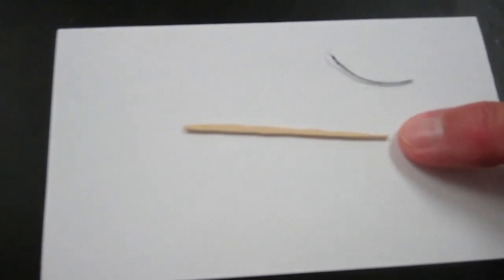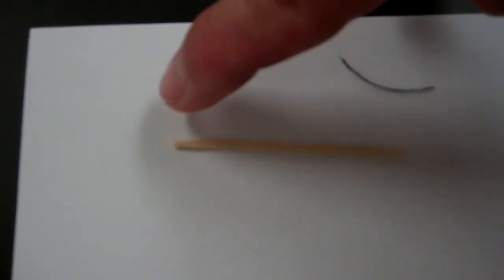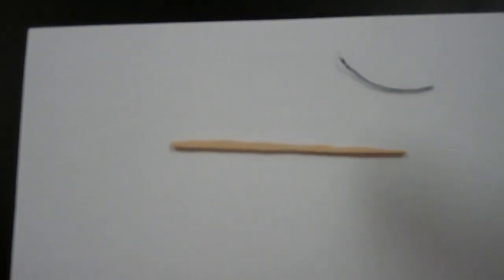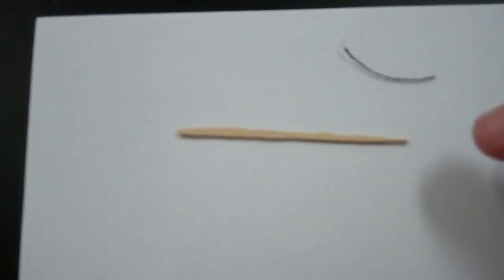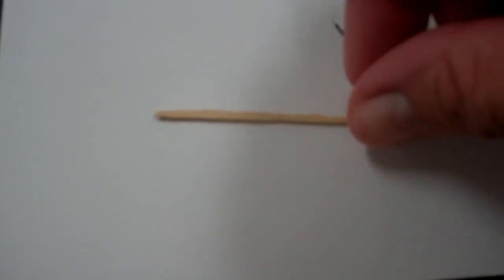The toothpick we're using has a small end or sharper end and a flatter, bigger end. You want the big end to go in your mouth and the sharp end in your fingers. So pick up your toothpick by the sharp end. You're going to put it in your mouth and go up and down twelve times, scraping against your cheek.